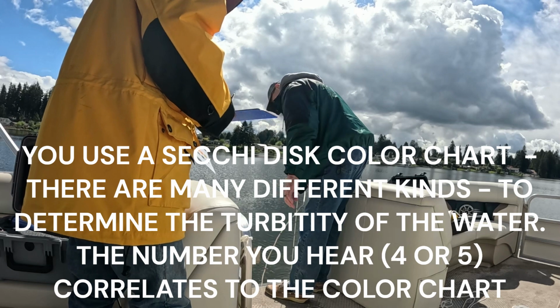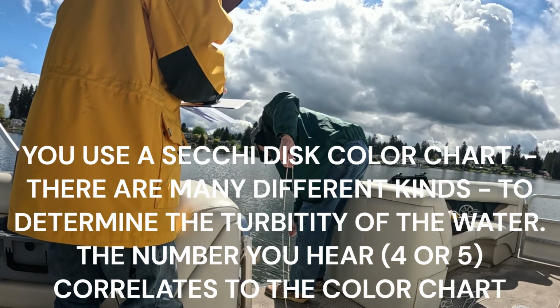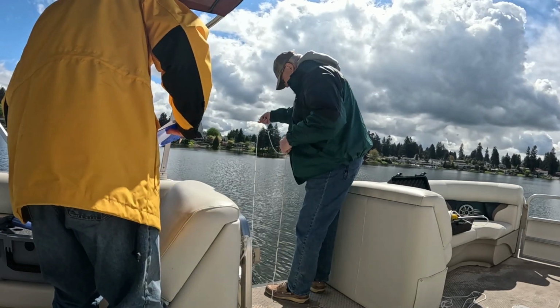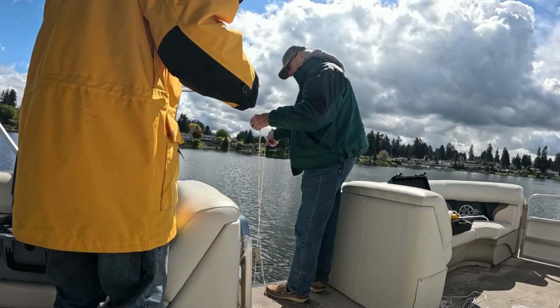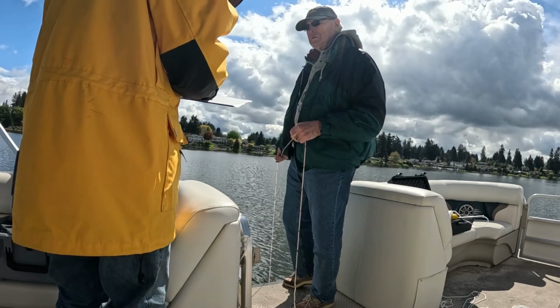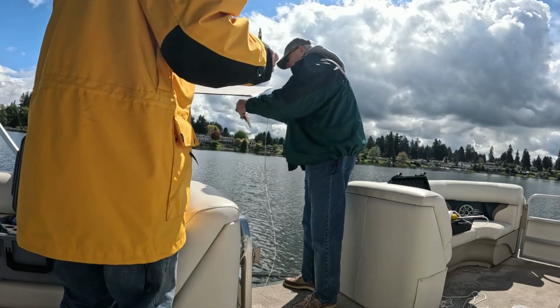See, the color's the same. Okay, so that's 4, and what's the depth? That's 5. And the depth was 2 3/10. Mm-hmm. What was the other one? 2.3. Okay. So 2 3/10, same. Actually pretty good.